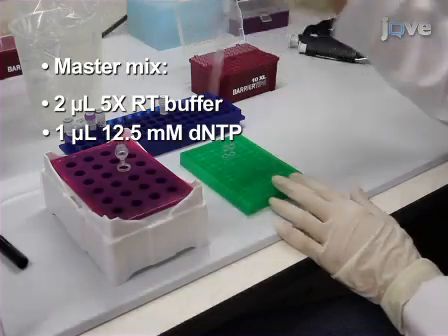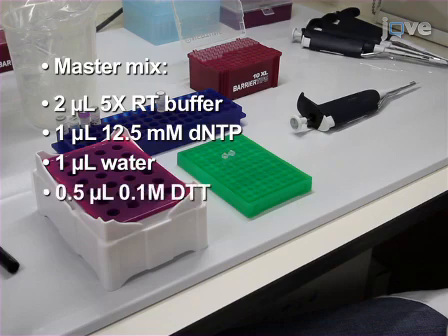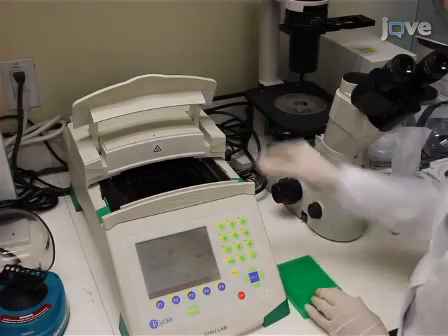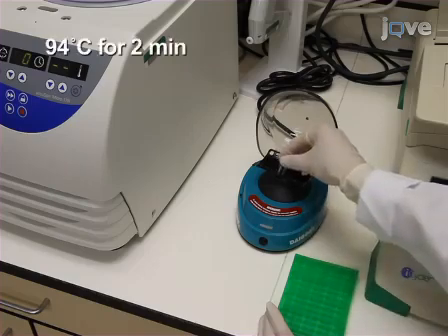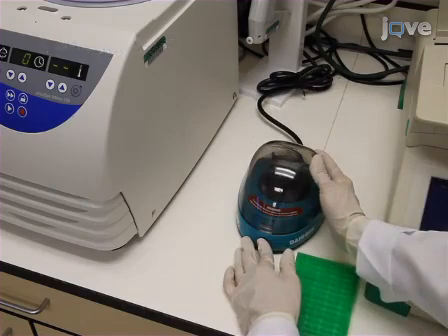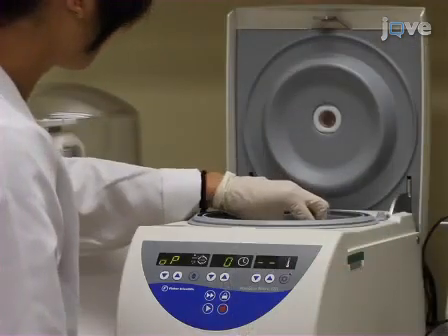Next, add 5 microliters of a master mix containing 2 microliters 5 times RT buffer, 1 microliter 12.5 millimolar dNTP, 1 microliter water, 0.5 microliters 0.1 molar DTT, and 0.5 microliters SuperScript III reverse transcriptase. In a thermocycler, incubate the tube at 42°C for 60 minutes. Then, heat the sample to 94°C for 2 minutes to abort the reverse transcriptase reaction. Cool to 10°C for 2 minutes and pulse centrifuge for 5 seconds.